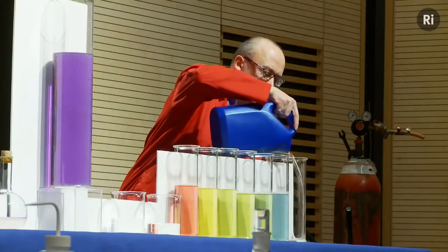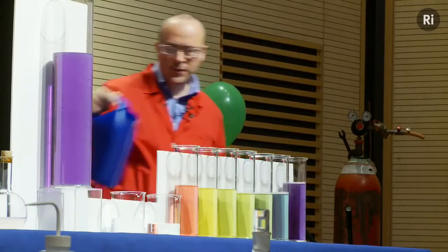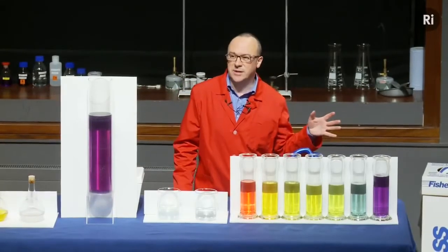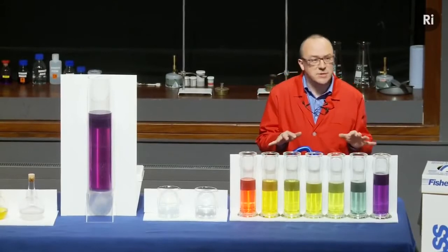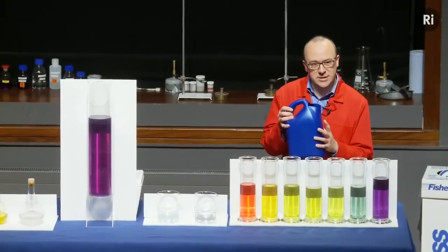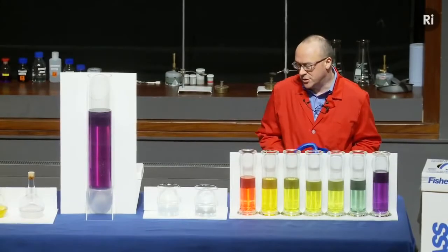So, in the dictionary, the word curious is defined to mean something which is puzzling or surprising or unexpected. And this demonstration might seem rather puzzling at first until we realised that the cylinders were not empty at the start. Each of them had a little speck of chemical which reacted with the liquid in this container, and it produced a colour change. We'll look at the chemistry of that in just a moment.